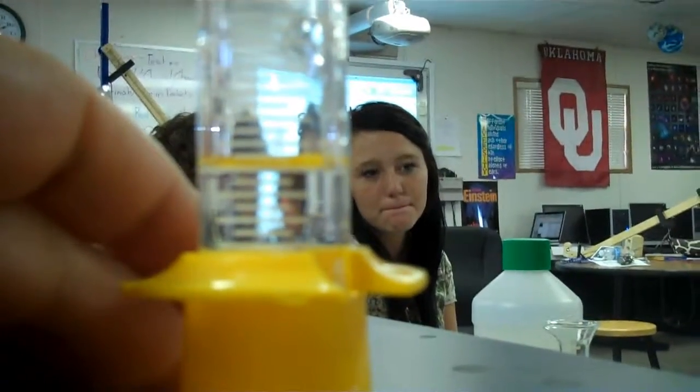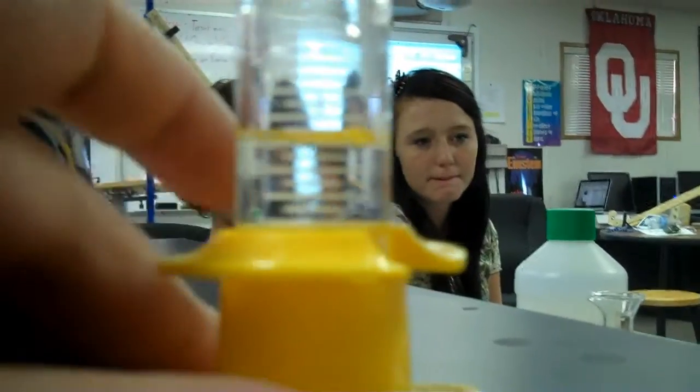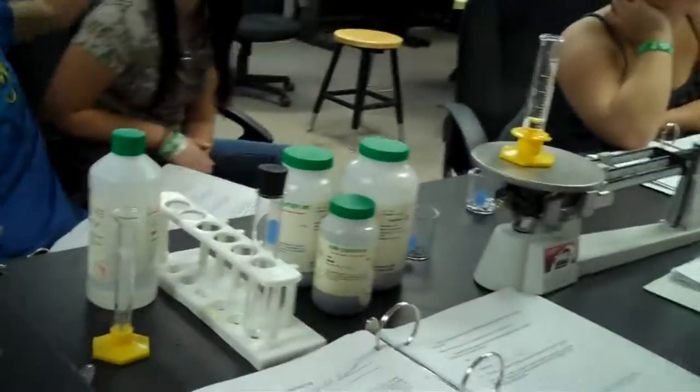Do I need to look at it too? Yeah, sure. Oh, it's only so slightly above it. But I think it's close enough, because it'd be pretty difficult to get it lower than that. It's like a tenth of a milliliter off. I'll just leave it on. Okay, which one are we doing next? Zinc? Or, as Jared said, the funky looking one? Funky.